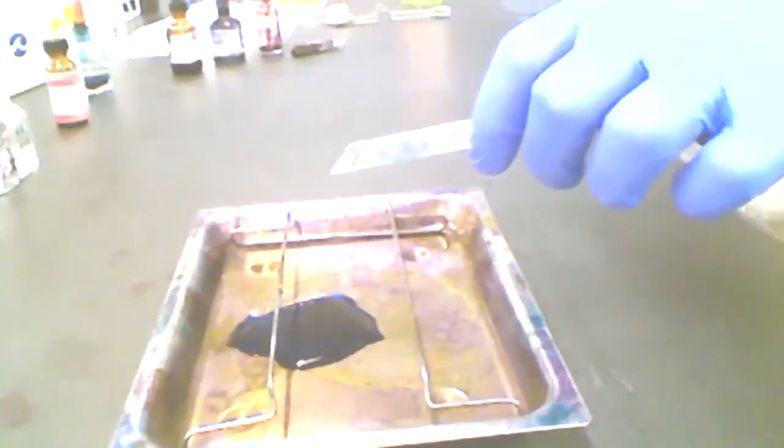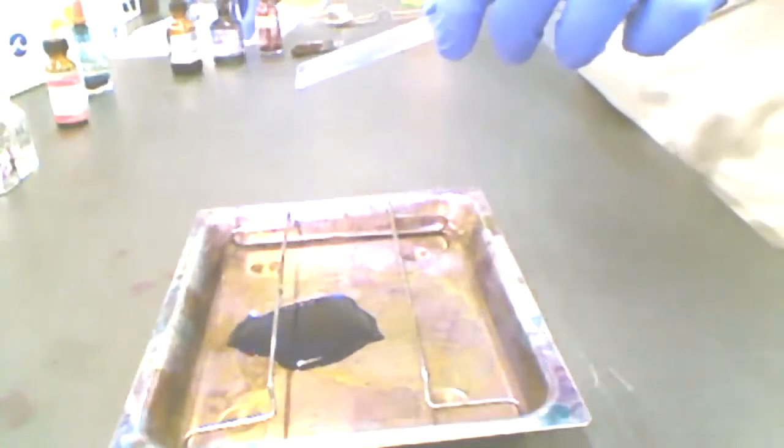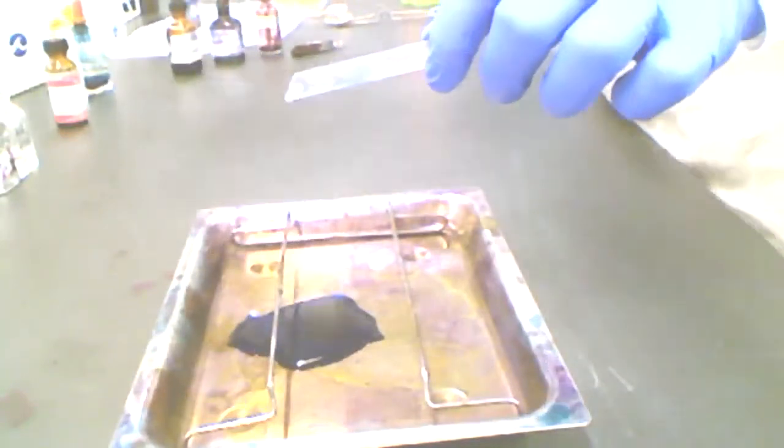And now the next step is to dry this slide. This is where my bibulous paper that I was waving around earlier comes back into play. There's my little booklet of bibulous paper. All I'm going to do is open the booklet, find some clean pages, lay that sopping wet slide in there and gently press down on it.